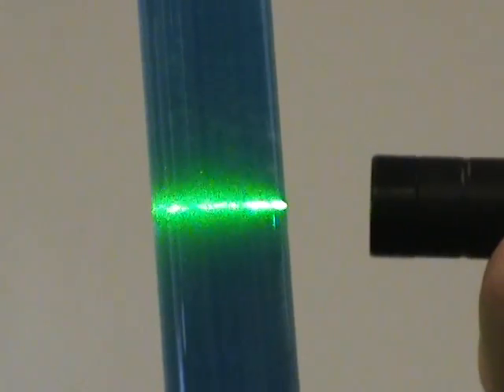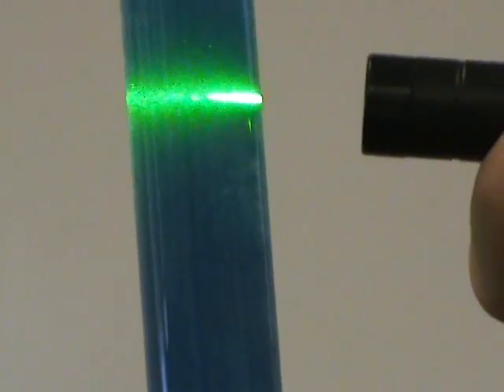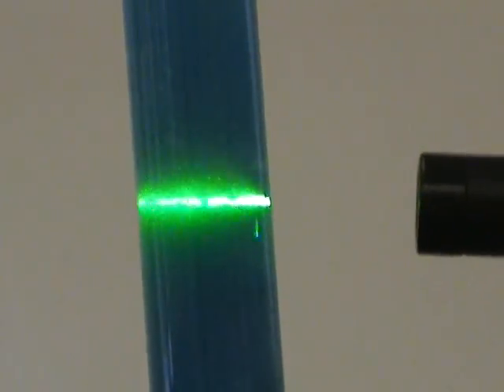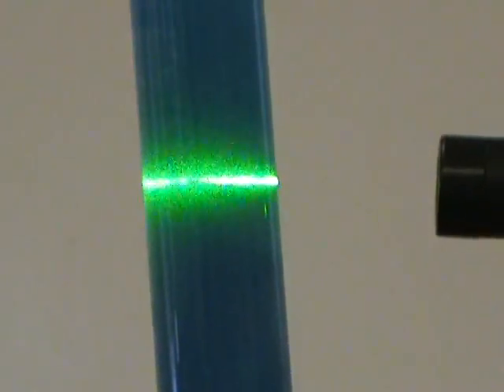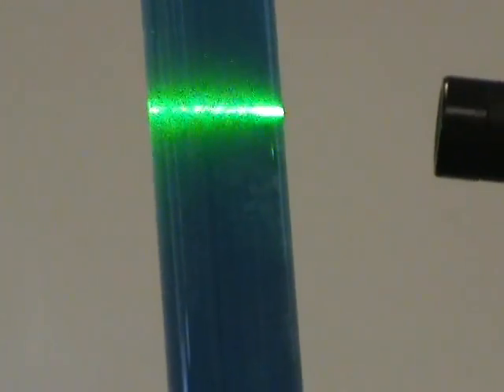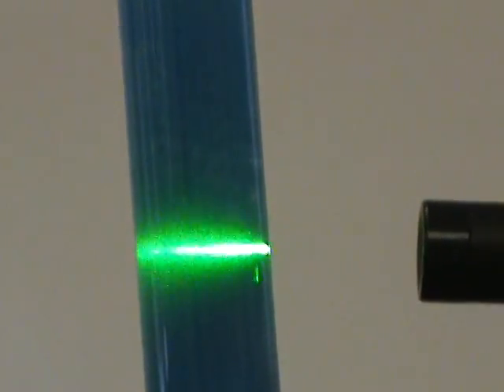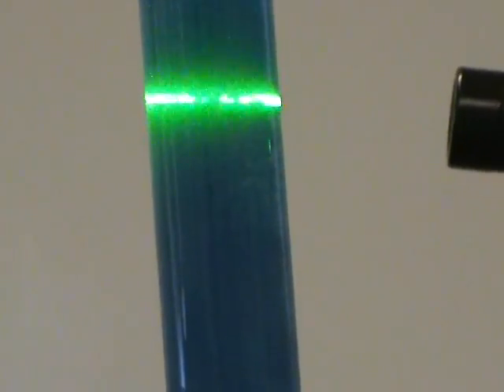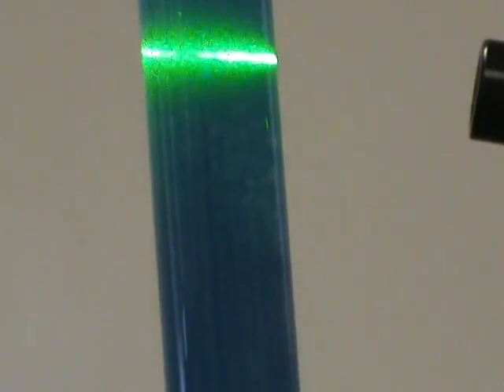Watch what happens when I shine the laser through it. It's pretty cool, isn't it? The reason why the laser beam can be seen is because the particles in there are so large that they reflect light very well, allowing you to see them. So that's an ionic reaction — extremely fast.